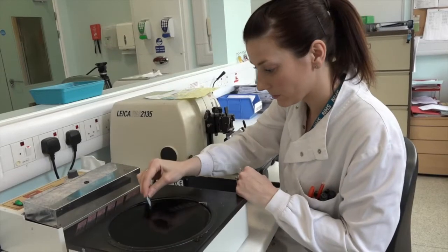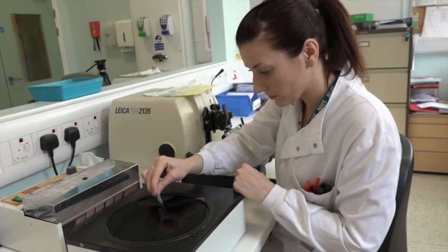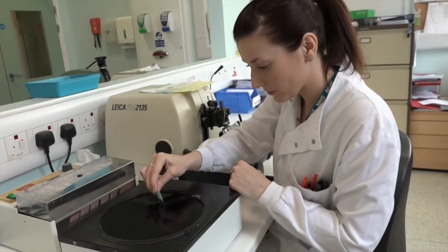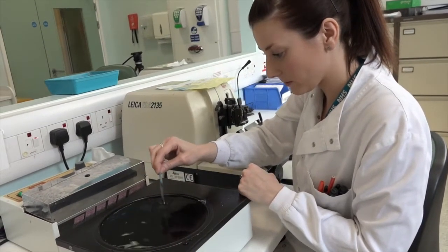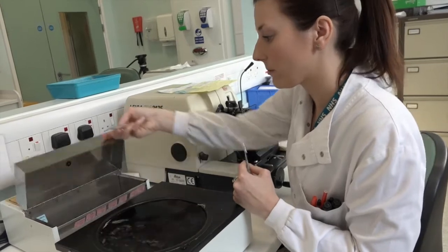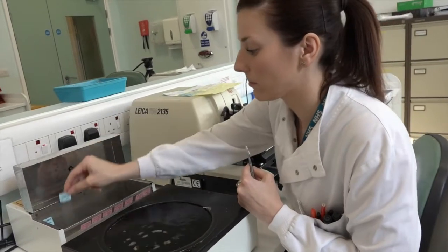It's important at this stage that the tissue has been embedded into the wax, because otherwise if we tried to take a section on these machines the tissue would crumple. The microtomes produce very thin sections of the tissue which are floated out onto a hot water bath and picked up on a glass slide.